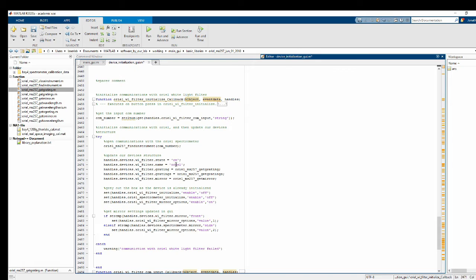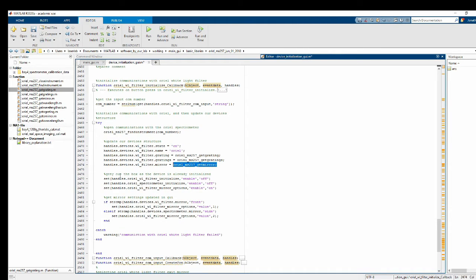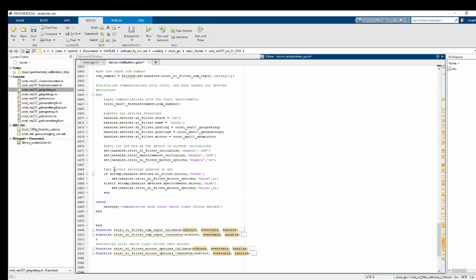The white light filter is the oriel. Currently we only have one filter in our lab, but in case we ever had more, you can follow this same structure. The grating and gratings is kind of silly, but we threw it in there. And then the exit mirror tells us whether it's going to the Thor Labs camera or the input to our system here. And then it looks like once you initialize the device, you gray out the box because it's already been initialized, and you turn on the mirror selection box. And then this is just reading the current mirror that is being used inside the oriel white light filter, and it's setting the GUI to match whatever the current setting is. So I'll show you that in a few minutes.